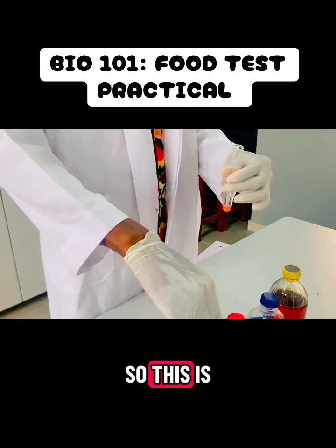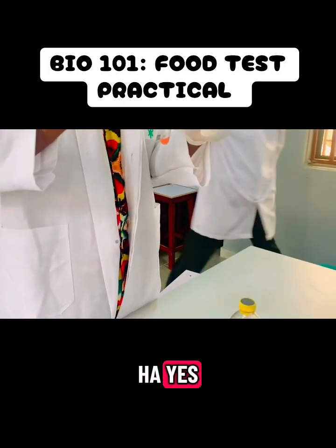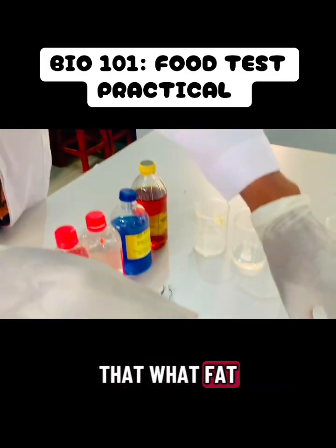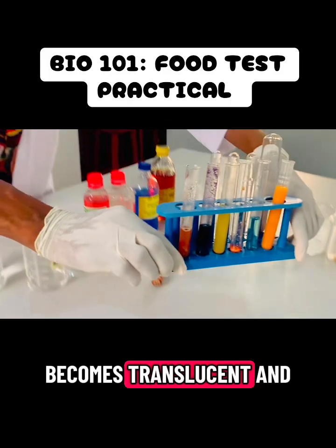So this is it. I have to just shake, and this is one of the simplest. Yes, it's just one of the simplest. It just turns to a red stained layer, showing that fat is present. We can also do the paper smear test, like if it is oil, you can just do your paper smear, and then it becomes translucent and all of that.